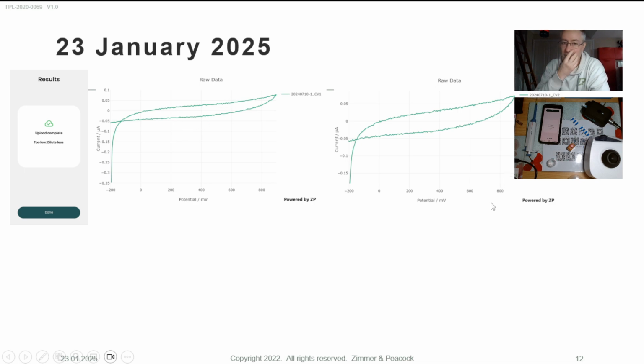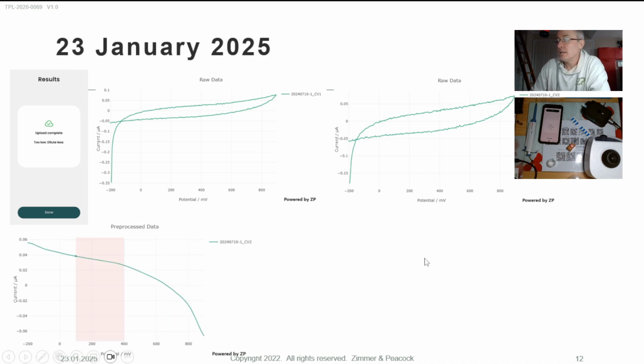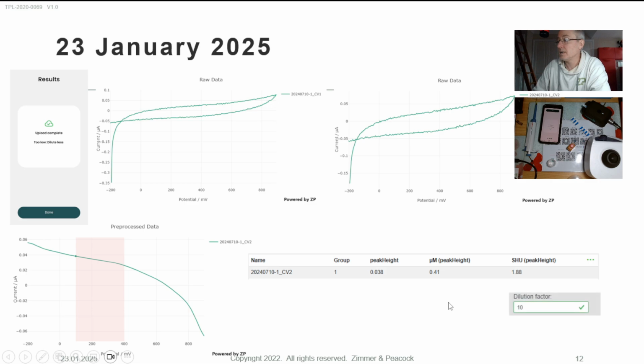Now, if you're not clear what that is, we do have lots of videos on YouTube about the peaks for capsaicin. And then we analyze it, and there is no peak there. But please wait, because I'm going to show you some other data in a minute, and you'll be able to contrast it. And then I'm able to also test what their dilution factor is, and I can see their dilution factor is 10. So the Sense It All is good because it will give you a result there and then. It will also give you guidance there and then. And also, rather than just storming forward, actually go up and have a look at the data as well, because I'll show you something that's more typical.